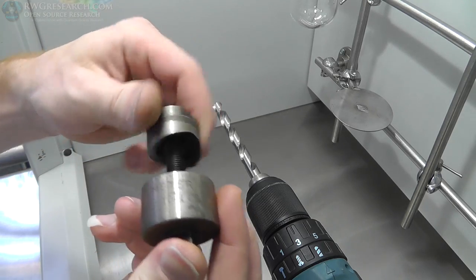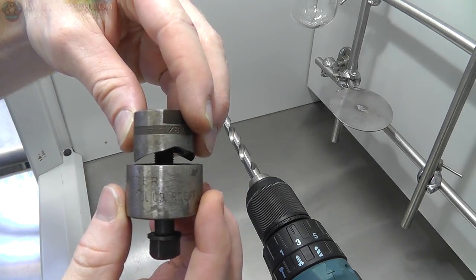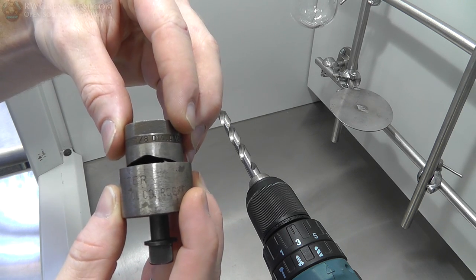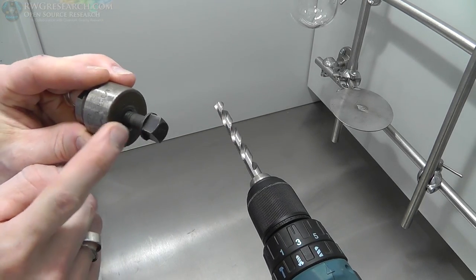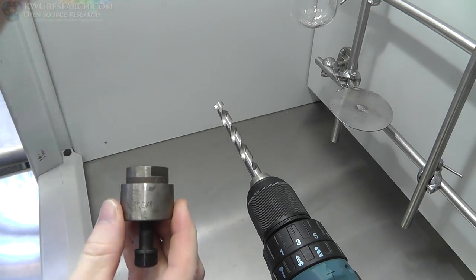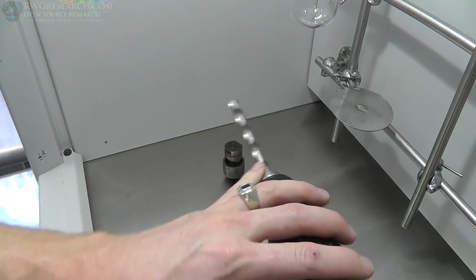Could be wrong. So this threads on there, and then as these compress together, it starts to cut a point there on both sides, and it works its way to the middle till it cuts all the way through. So you only have to drill a hole a little bit bigger than whatever this bolt here is, and then you just turn this and slowly compress them together and pop it out. So I figured some of you have never seen such a thing, so I'm gonna show you.